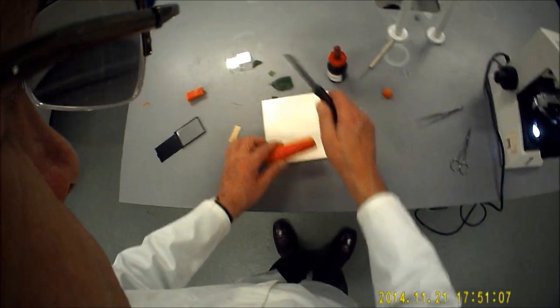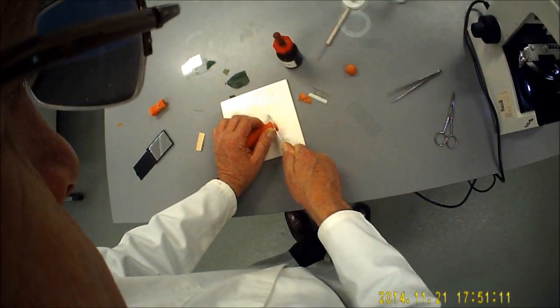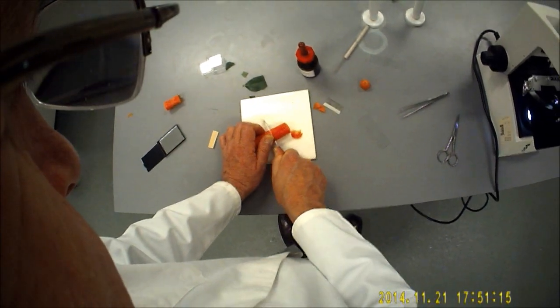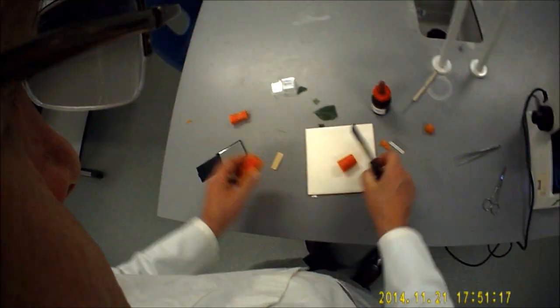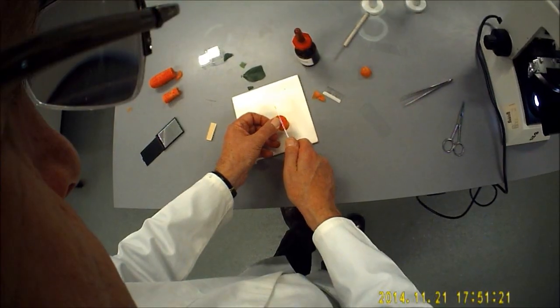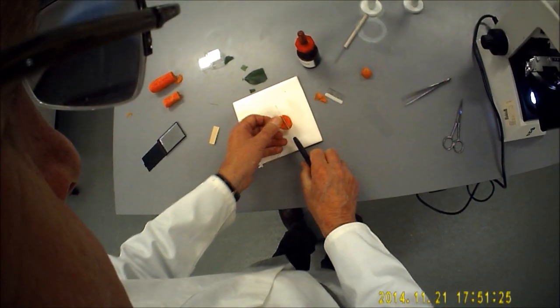We're going to use the carrot as a vice for the leaf. So we take a carrot and we take a little bit off it like so. We're going to put a slit into the carrot and we'll just put that to one side.